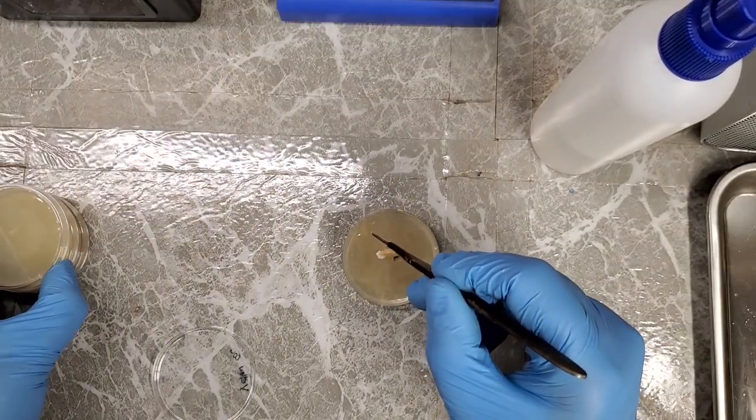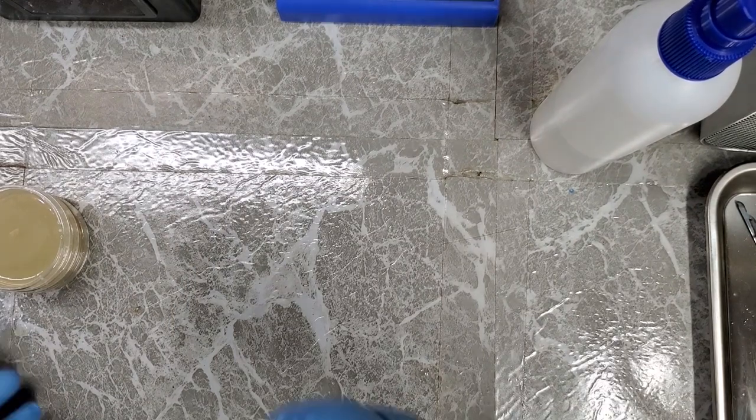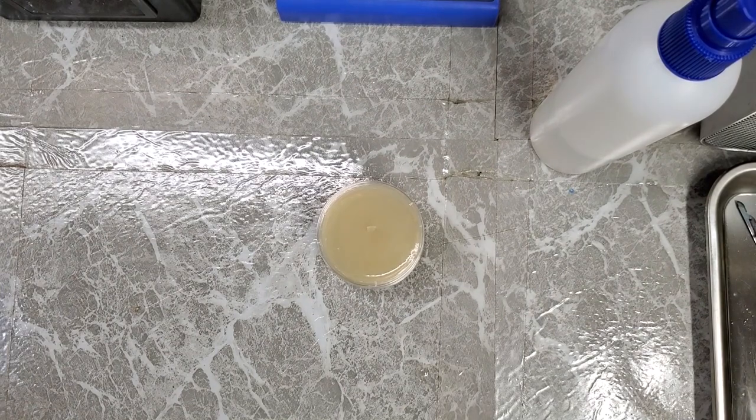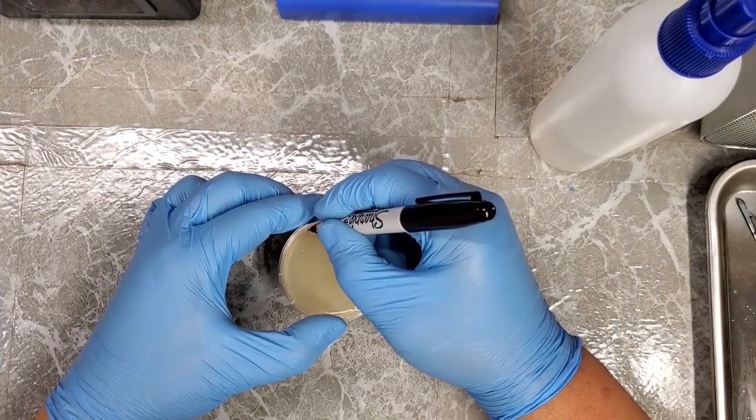Okay. That off to the side there. And now, move these guys here. Now all I gotta do is label them.